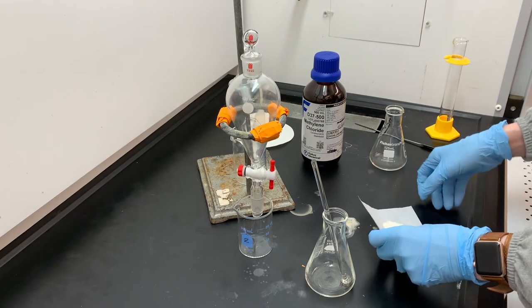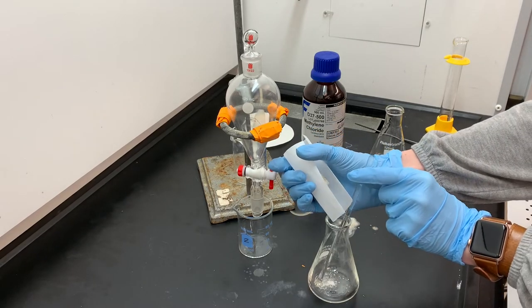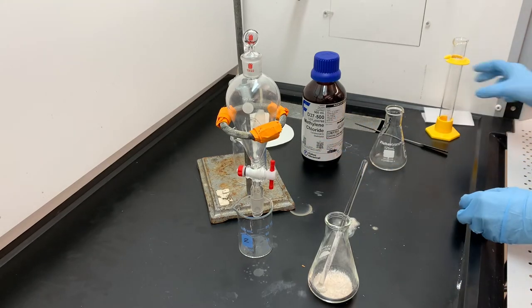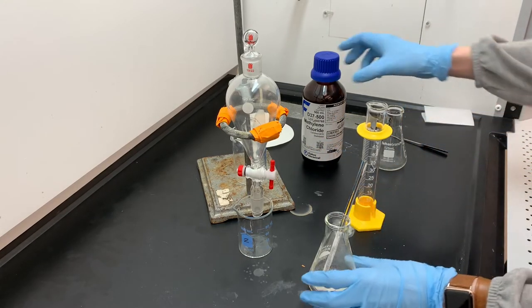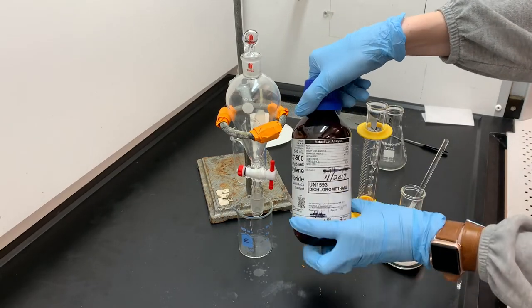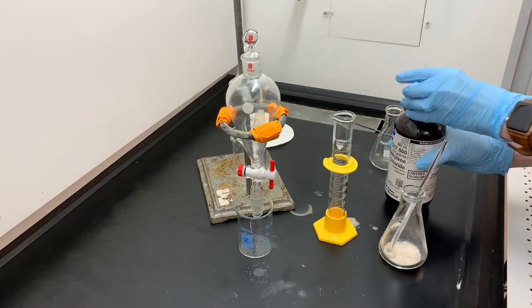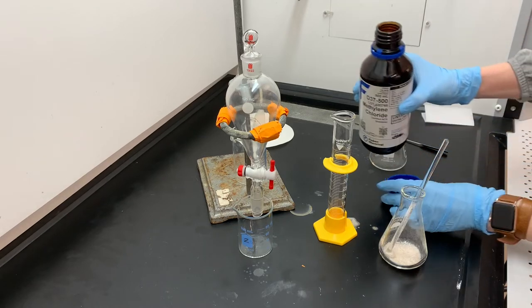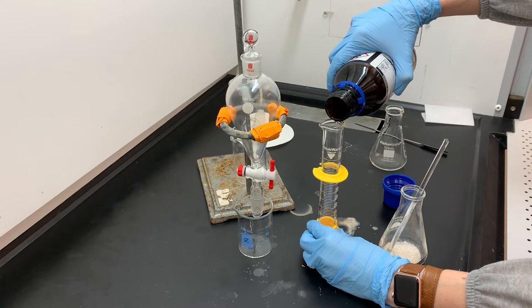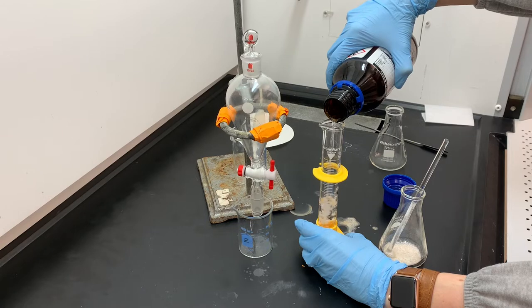Now we're going to take the approximately three grams of panacetin, put it into this Erlenmeyer flask, and then dissolve it in our solvent, which is the methylene dichloride — also called dichloromethane. We need approximately 50 milliliters. The exact volume doesn't really matter; you just need to have enough that all of the components that are soluble in the dichloromethane are actually going to dissolve.